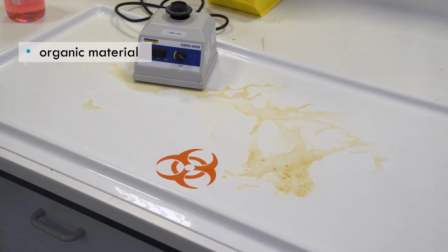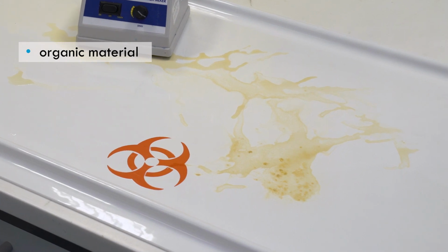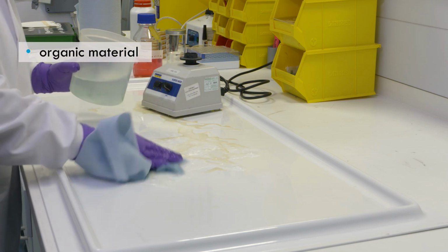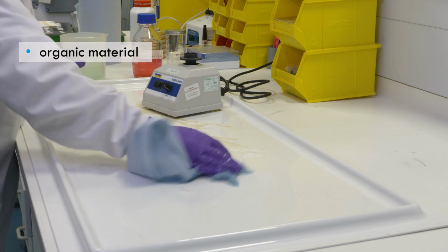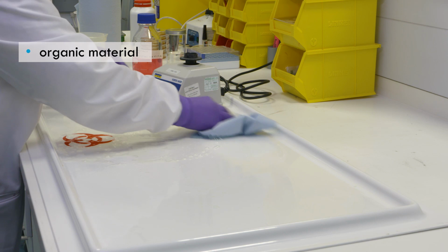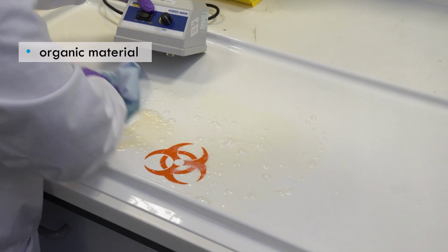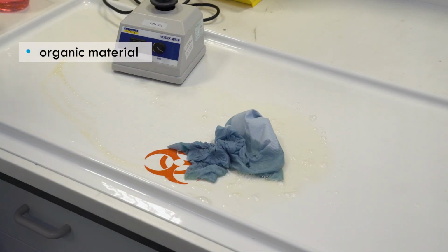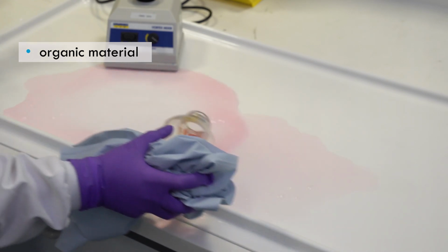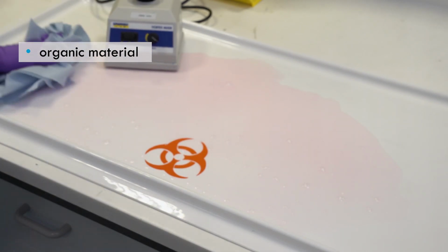Disinfectants may become inactivated by contact with other chemicals or organic materials such as bodily fluids and residues. Solid organic matter can prevent the disinfectant from reaching the target biological agents within and beneath the organic material. In these situations, it may be necessary to clean the area with detergent to remove the bulk of the organic material before surface decontamination with a disinfectant. You may also need to increase the concentration of the disinfectant, increase the contact time, or use an alternative disinfectant product.